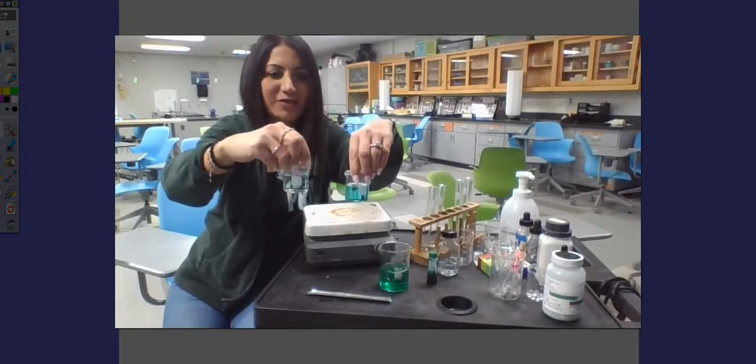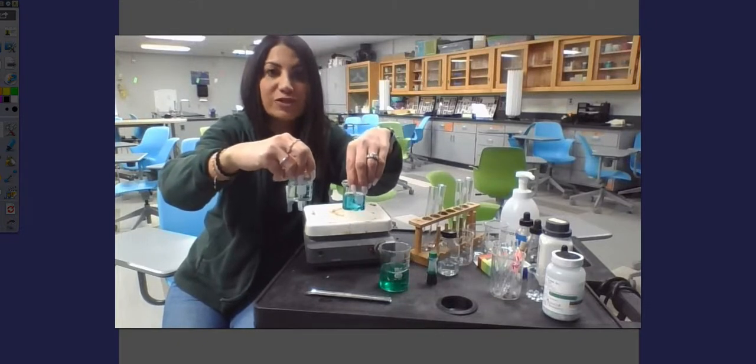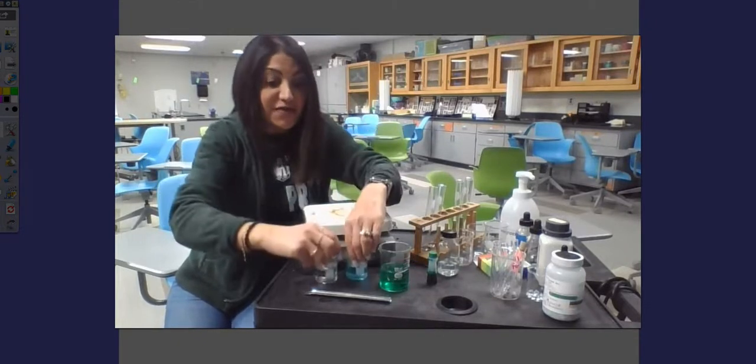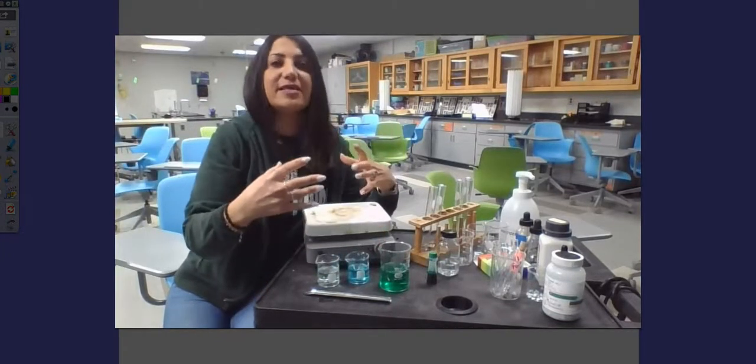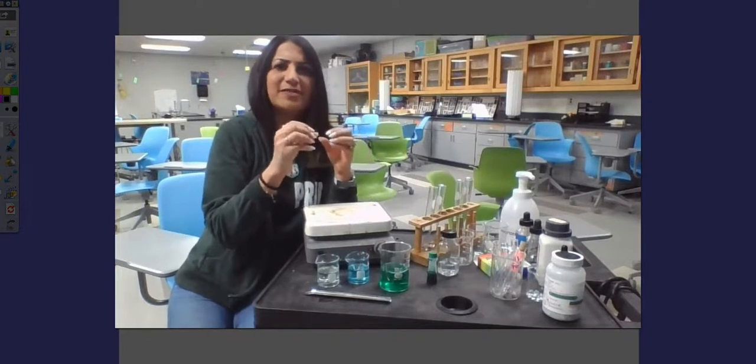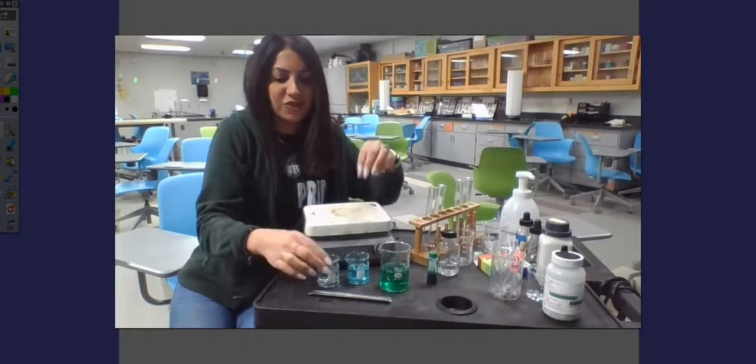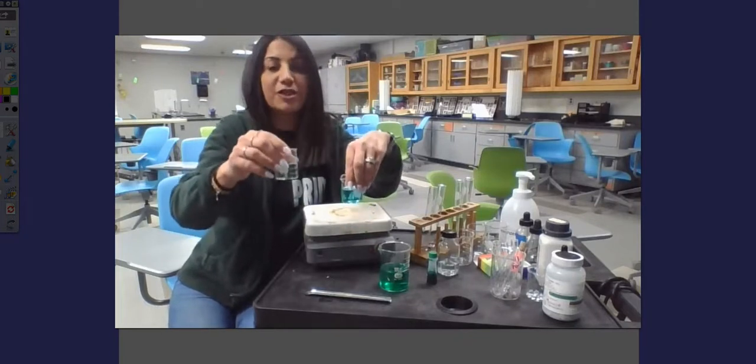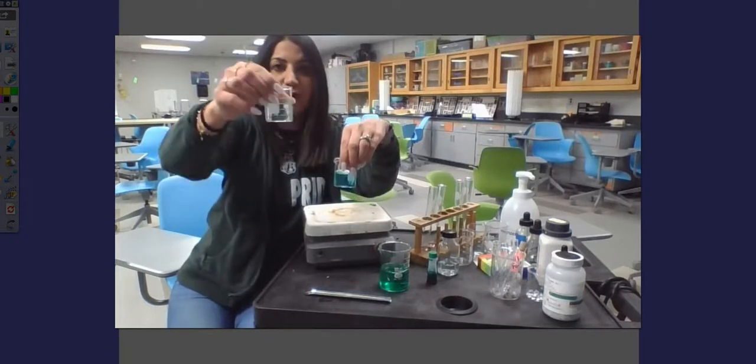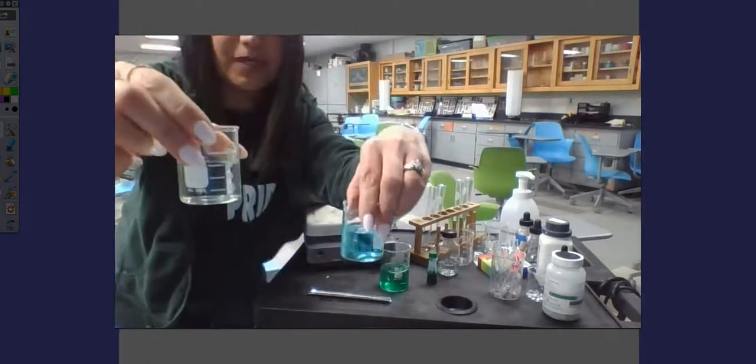I want you to think about the molecules inside. Those molecules should be moving faster. They're hitting into each other, bumping around. And so I was talking about that molecule inside that gets oxidized, which just means you're adding oxygen to it. Because they're moving faster, they're actually able to add those oxygens much more quickly. And there we go. This one is pretty much clear.